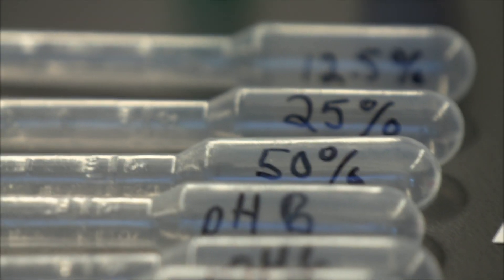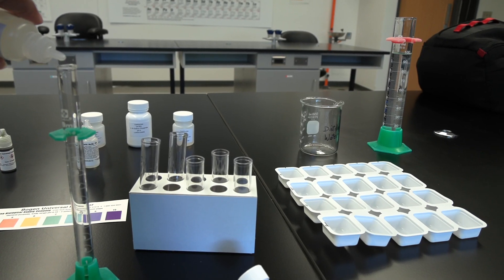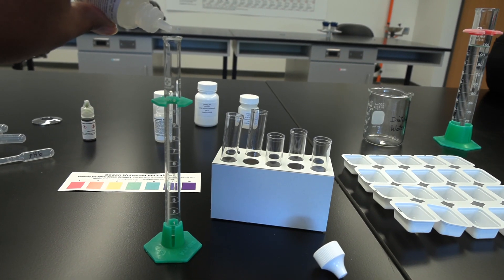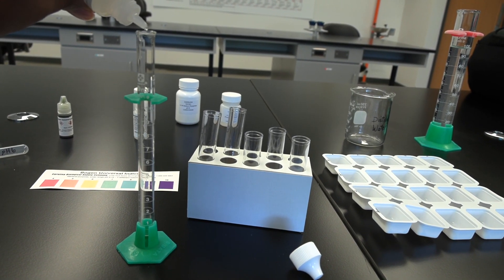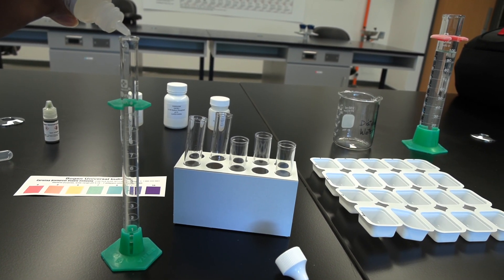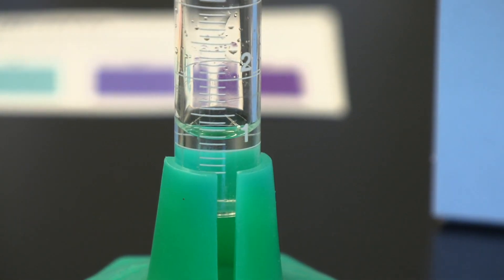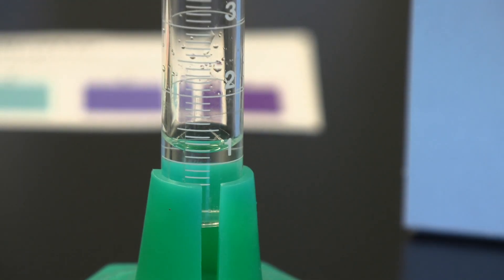Add approximately 100 milliliters of distilled water to the 250 milliliter beaker and add the water dropper pipette to the container. Calculate the volume of one molar sodium hydroxide needed to prepare 12 milliliters of a 0.1 molar solution and prepare this solution. Calculate the volume of one molar hydrochloric acid needed to prepare 12 milliliters of a 0.1 molar solution and prepare this solution.